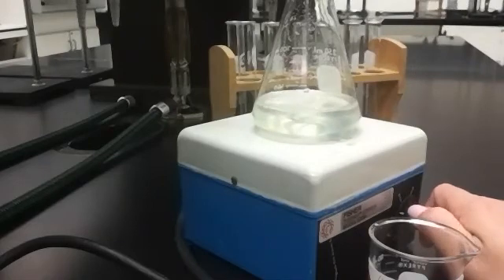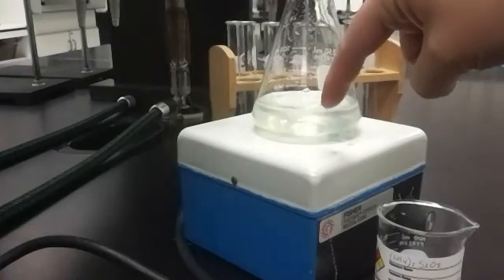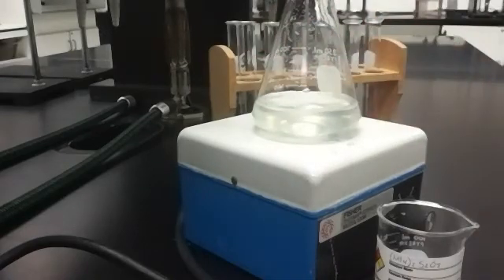But the reaction is not going to start until I mix one of those test tubes in that beaker into the flask. At that point, the reaction starts, and the iodide ion that is currently inside this flask is going to start converting into iodine. And we're going to measure the time that it takes for that to happen. So pretend like you got your stopwatch out. Let's be honest here, I'm not going to sit here and measure times. I'm just going to show you how the reaction works, and I'm going to send you some data that has the times in it. So you're probably not going to see me taking times, but that's what you would be doing.